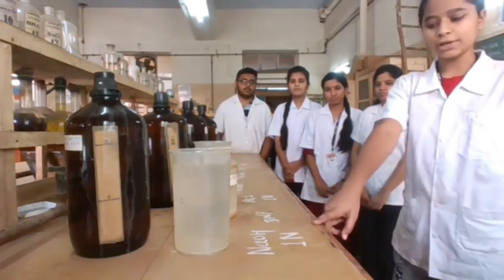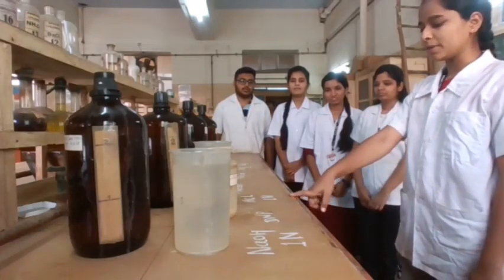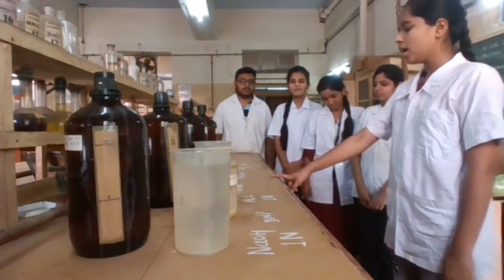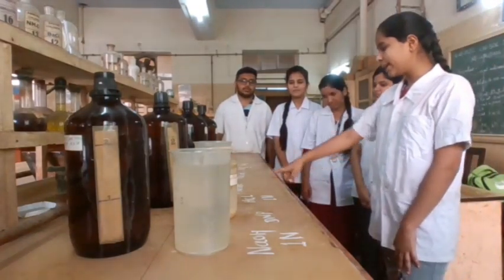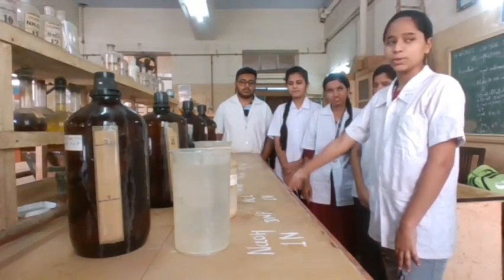1 normal NaOH, DAP fertilizer, 1 normal HCl, ammonium nitrate, ammonium molybdate, concentrated nitric acid, and distilled water.